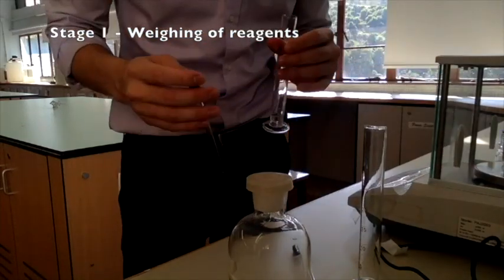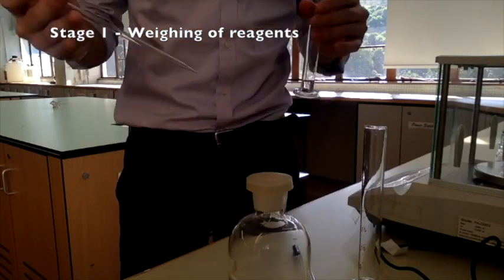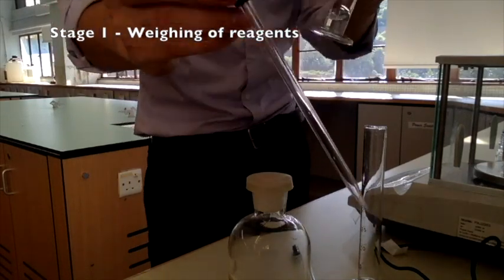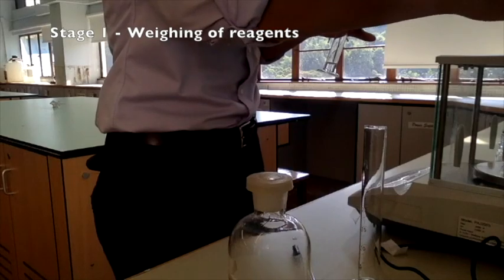Now, if you really want to have the weighing very close to 0.25 moles or 15 grams, after you have added around 14 grams, you can use a dropper to finish off the remaining mass of alcohol.